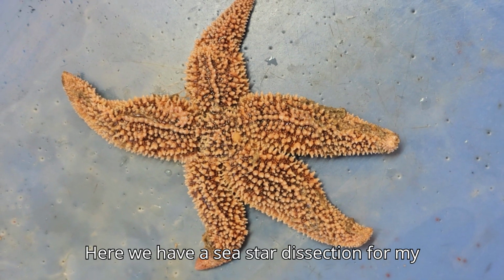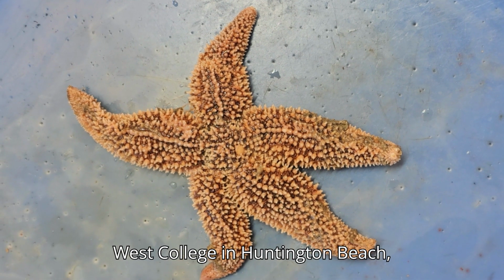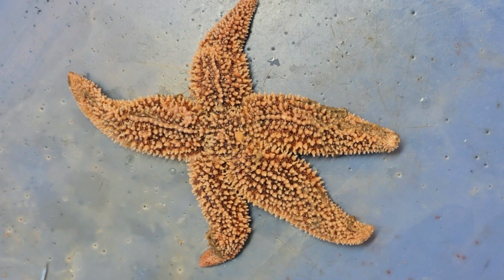Here we have a sea star dissection from my zoology students, Biol G182, here at Golden West College in Huntington Beach, California. First, we'll be looking at the aboral surface. This is the aboral surface, meaning it's the opposite of the mouth.